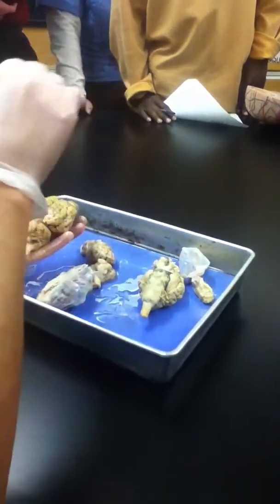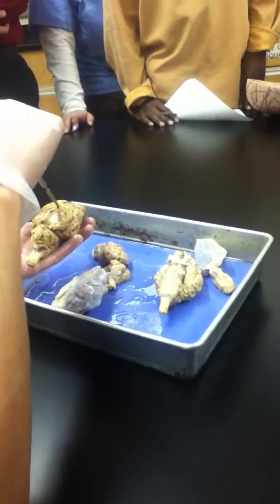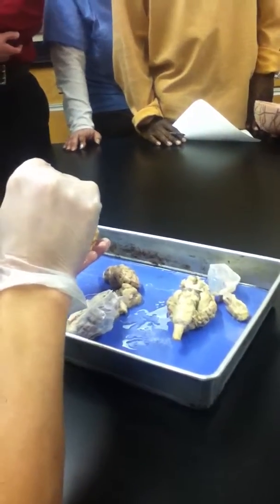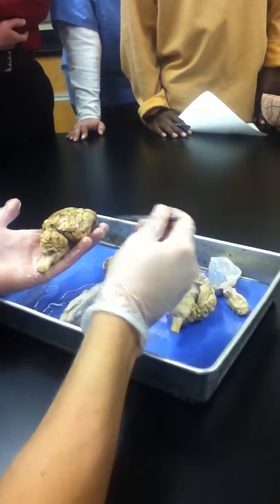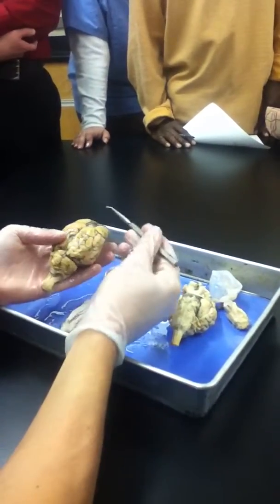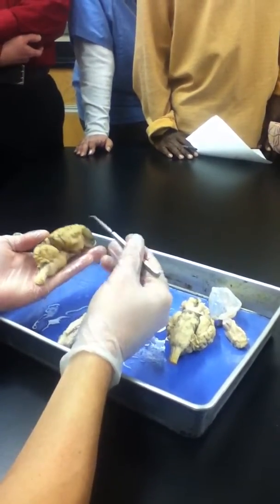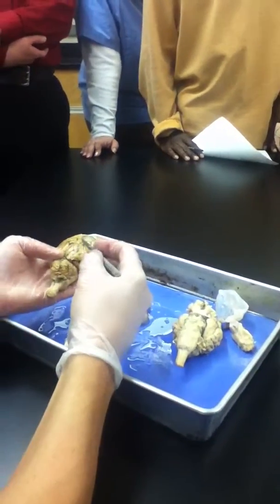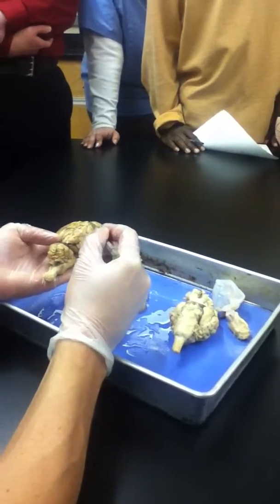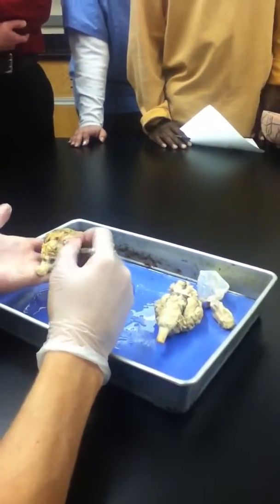Let's pretend this was the practical, and there was a pin here that said name the space. Longitudinal, otherwise known as sagittal fissure. Name the space. Transverse fissure, good. What is this whole brain structure, all of this? Cerebrum, good. What would you say if I said name the lobe here? Frontal lobe. Here? Parietal. Here? Occipital. Here? Temporal. Good. What would you name any of the bumps on the surface of the cerebrum, like this? Gyrus. A gyrus, and anywhere there's a dark line, there's a blood vessel there corresponding to an indentation, good. A sulcus.